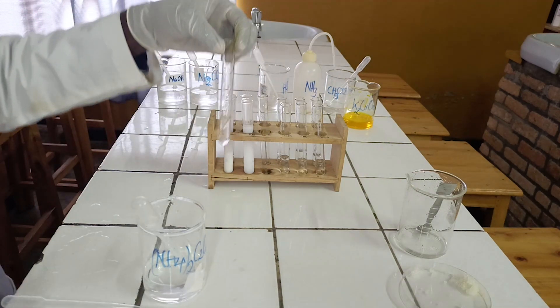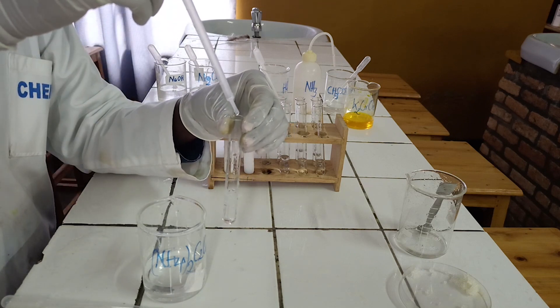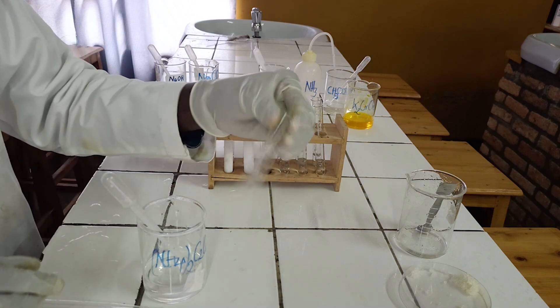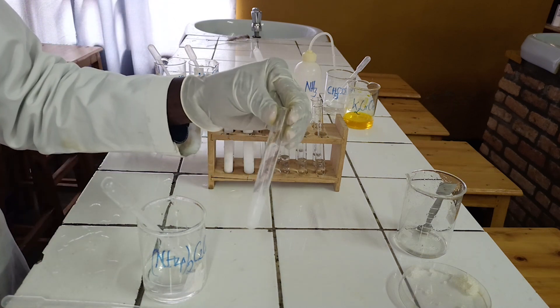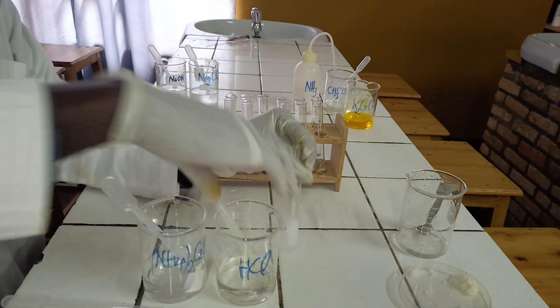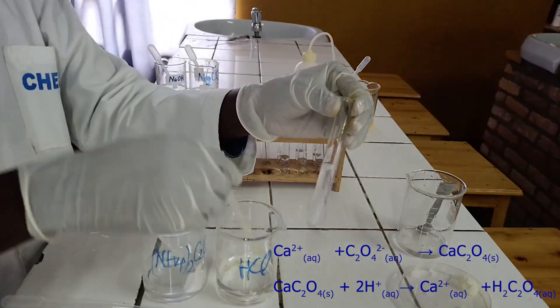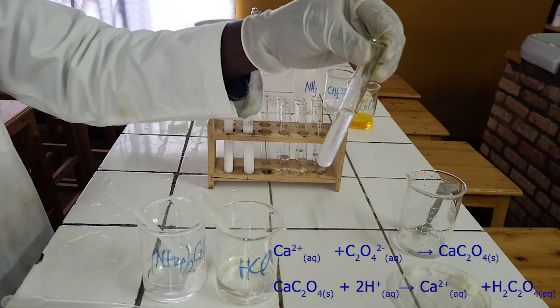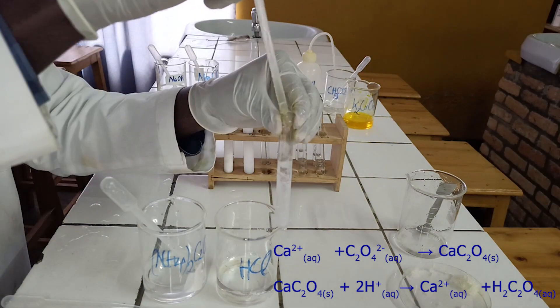To the third test tube, add a few drops of ammonium oxalate solution followed by diluted hydrochloric acid. As you see, ammonium oxalate reacts with calcium ion to form a white precipitate, which is soluble in hydrochloric acid solution. Below, there is an ionic equation for this reaction.